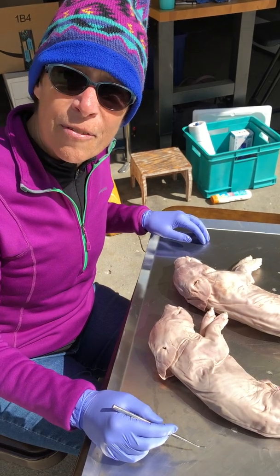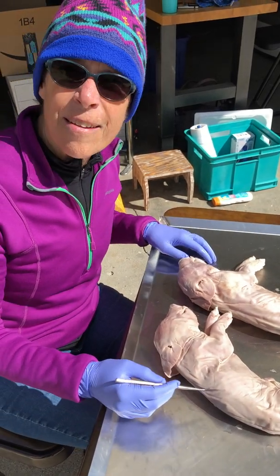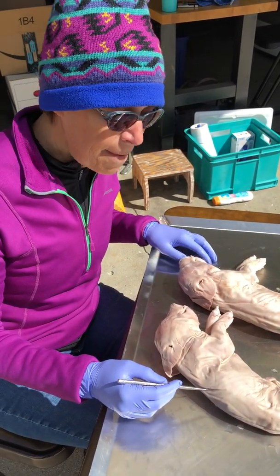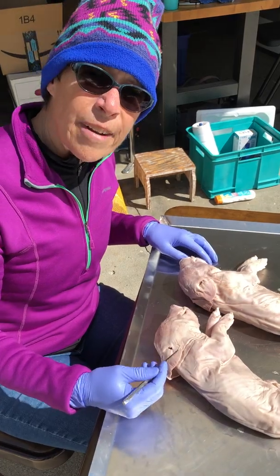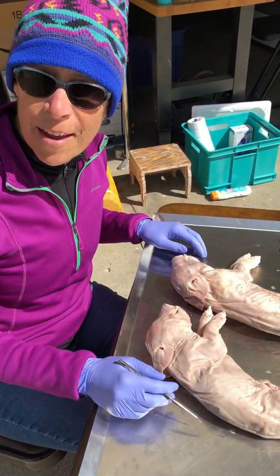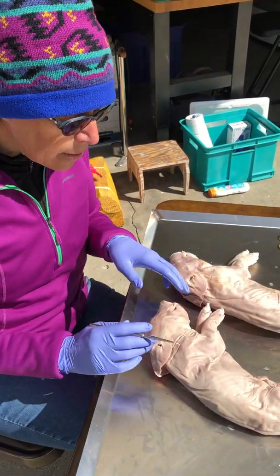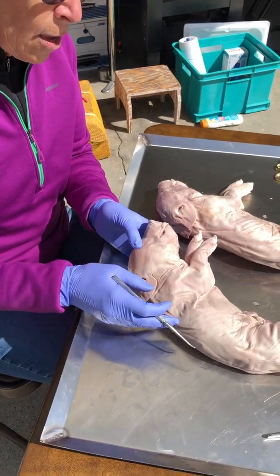So external anatomy of the fetal pig. We have here a male and a female pig, and we're going to start with the external anatomy of the head. Since it's the same in males and females, we'll just do this little one.